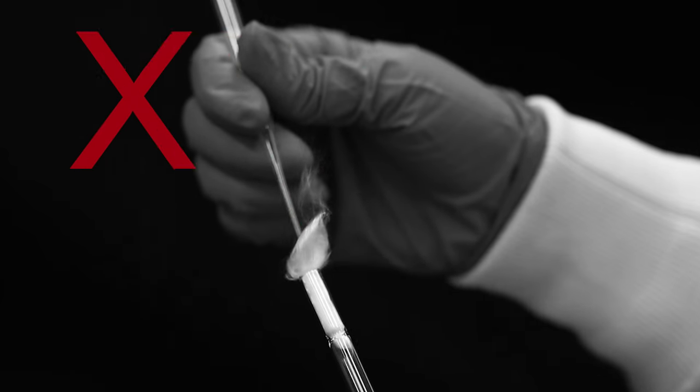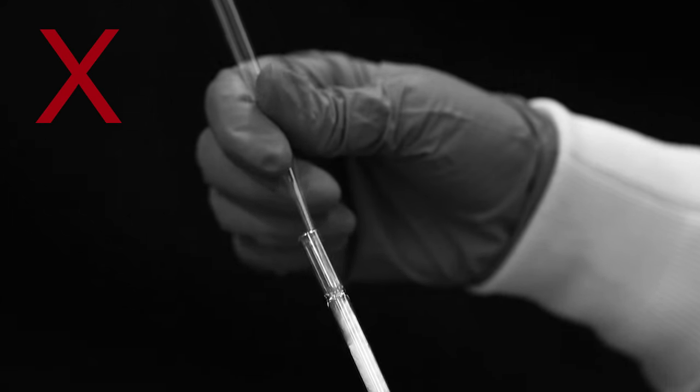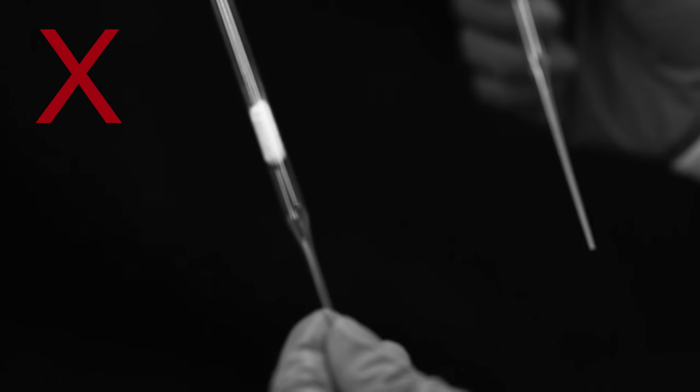Be sure to not use too much glass wool. If too much glass wool is present, the flow rate of the liquid being filtered will be restricted.